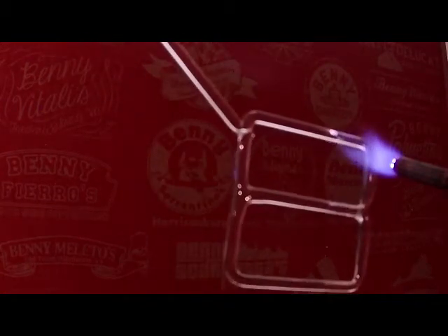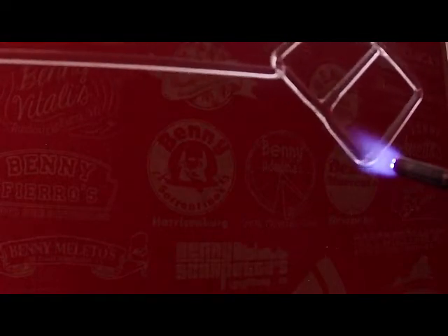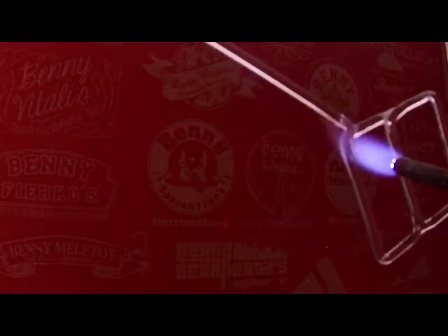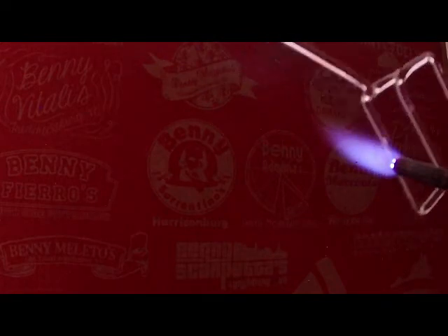What I like to do is once I've got essentially the whole thing bridged up, I can come back to each one of these corners and soften them. And that certainly will minimize any stress if I'm concerned about one of my bends going to essentially crack at some point. Here I'm just giving it a very, very light heating, and that should soften it enough. I want to be careful here because I've got my punty.